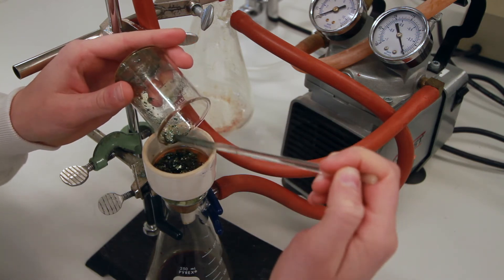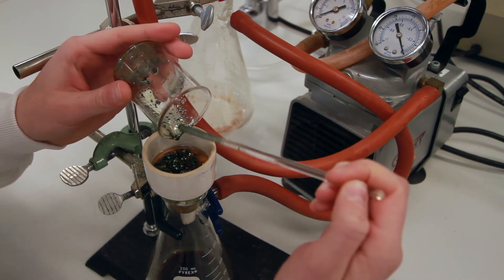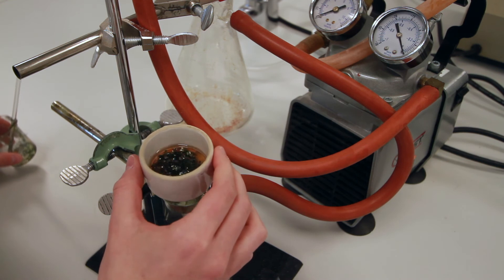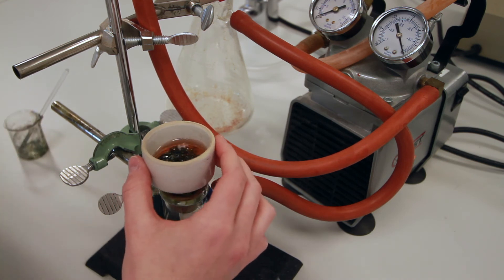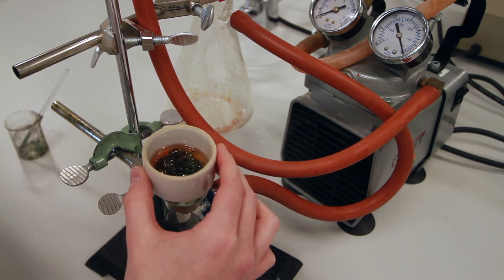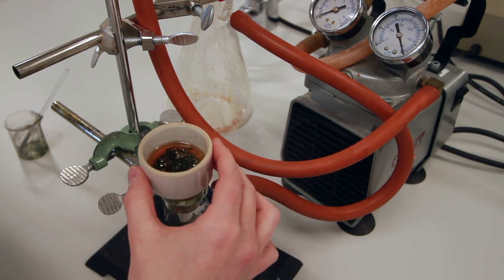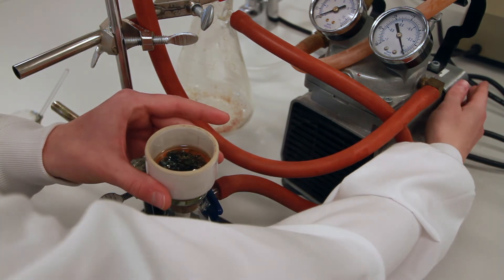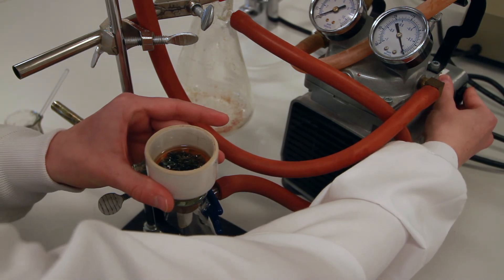Get as much as you can out of the beaker, and then swirl your funnel to completely cover your crystals in the wash solution. Turn on the vacuum pump to remove the wash solution.